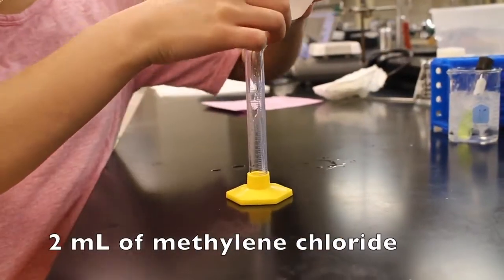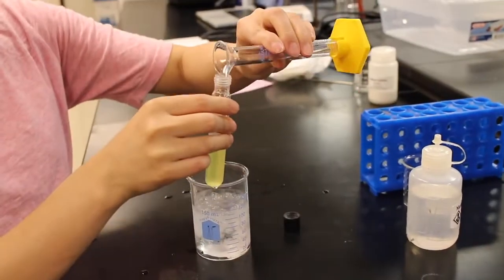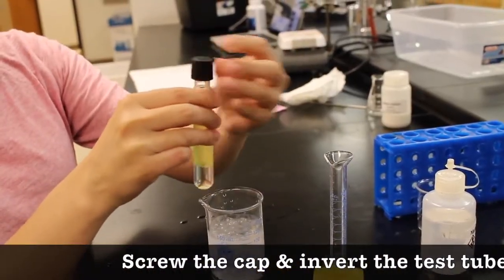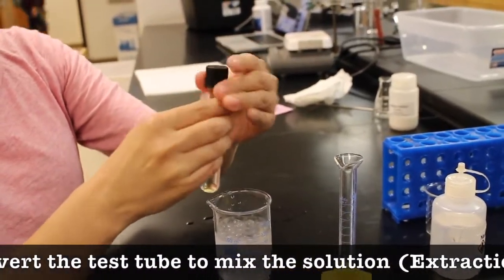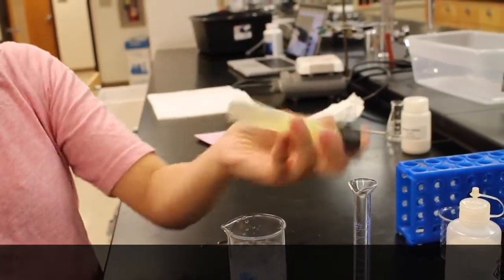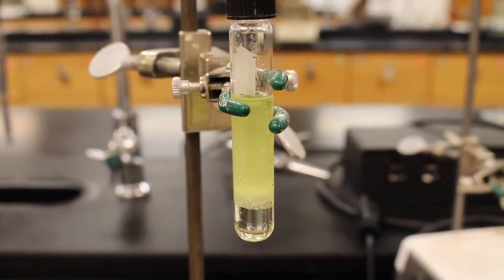Measure 2 milliliters of methylene chloride. After 3 minutes, add the methylene chloride to the test tube. Screw on the cap and invert the test tube to mix the solutions. This is when the extraction occurs as you shake the aqueous and organic mixture. This is how the organic and aqueous layers separate.